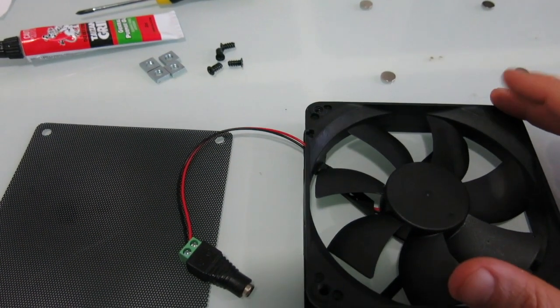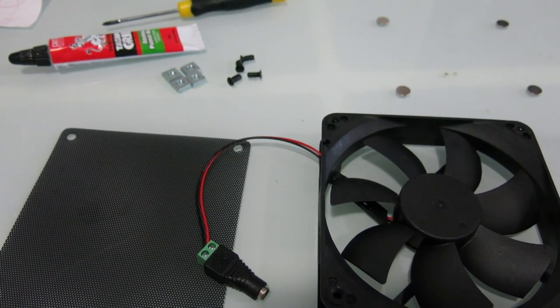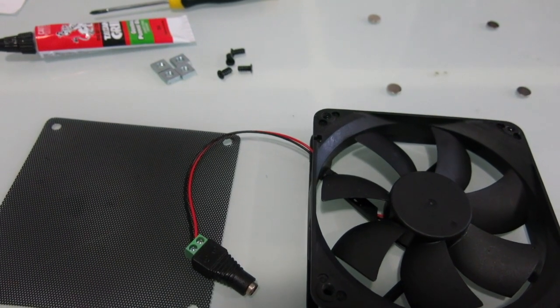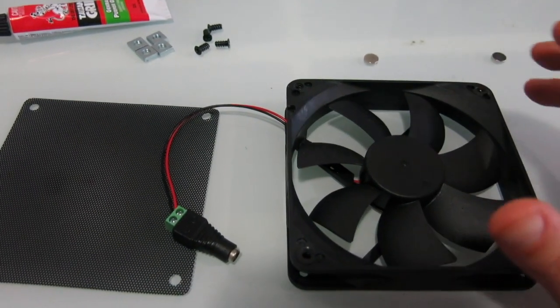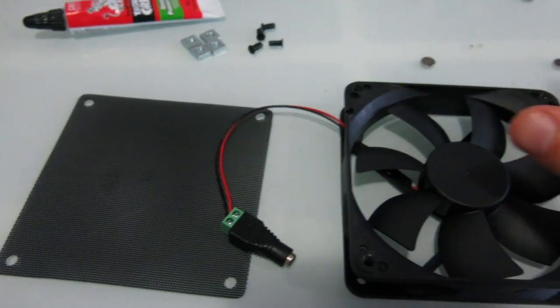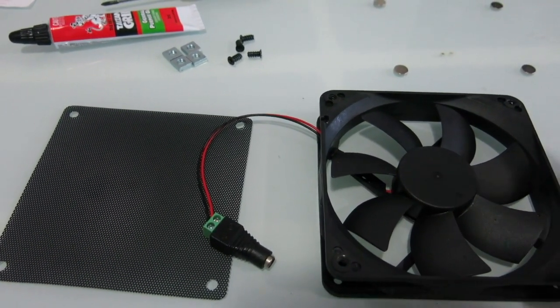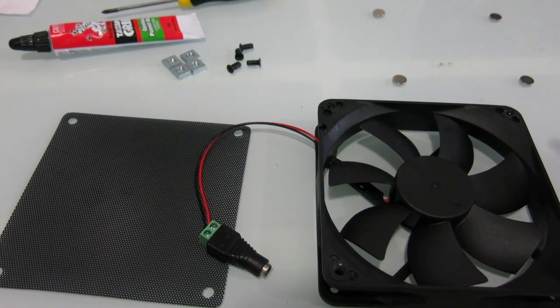And the reason why I'm building this is because my magnetic stirrer recently died, and I believe it cost way more than what it should have, and so I am building my own for about 12.5% of the price. So all up, this cost $10, all this stuff, and the magnetic stirrer I bought cost $80.